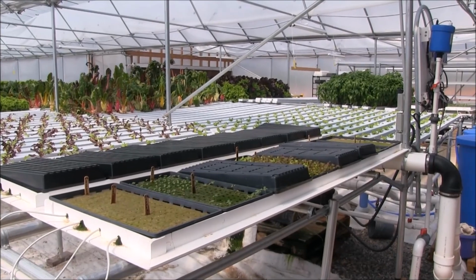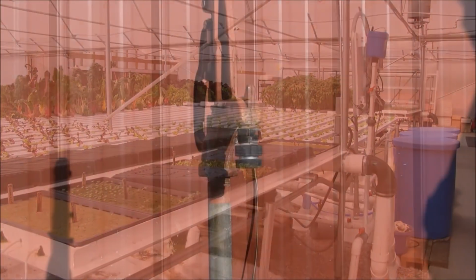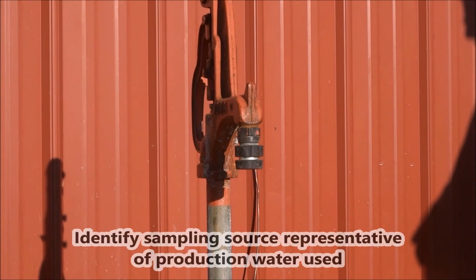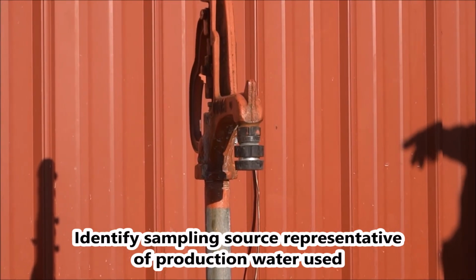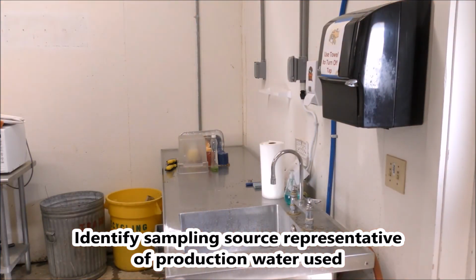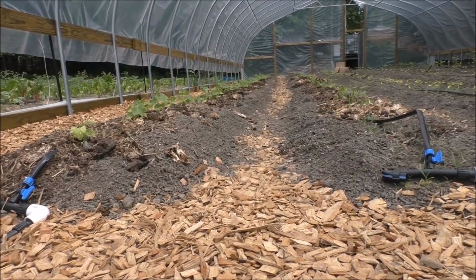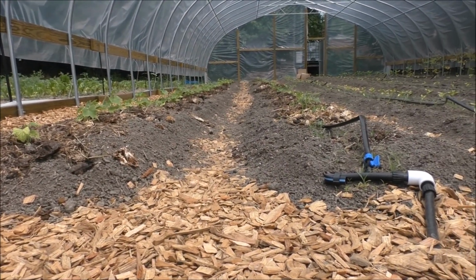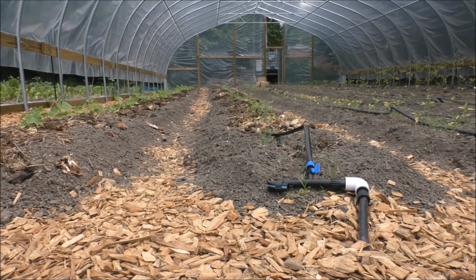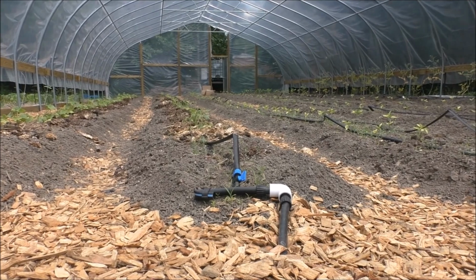Prior to the collection day, identify where you will collect the groundwater sample. Typically, you can obtain a representative sample by turning on a spigot that provides water for production areas. For example, you should not sample from the house tap if the house tap water has a chlorinator in the line and the production water as used is not chlorinated. Water collected from the end of a pipe or distribution system should reflect typical conditions during water application.